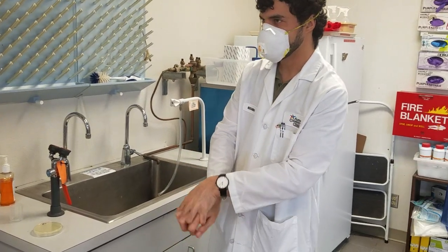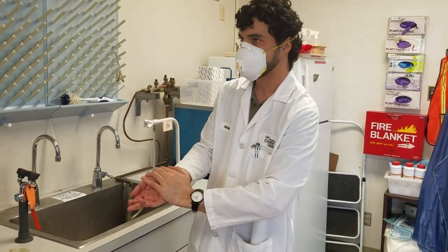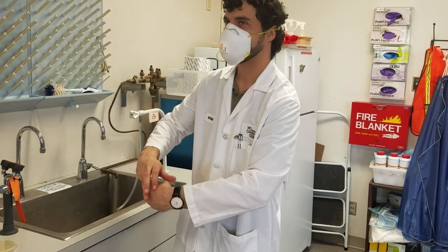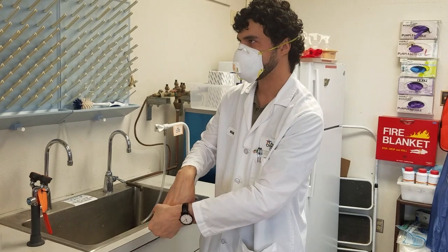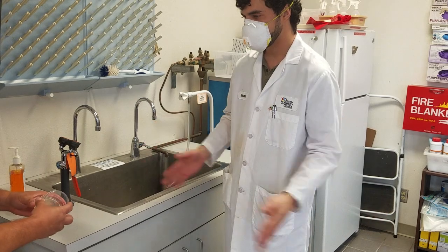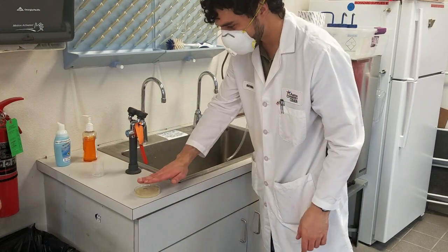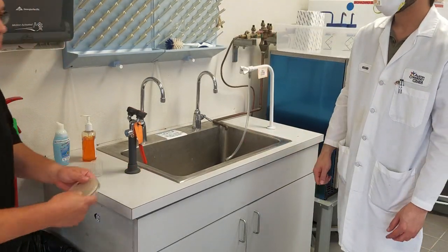One thing to note is that everybody in this video is a laboratory professional, so their technique is a lot better than we would normally see with students, although with the SARS-CoV-2 pandemic everyone has gotten more diligent about keeping their hands as clean as possible. Now his hands are dry and he's going to make an impression of his fingers and thumb. These will be incubated for 24 hours at a permissive temperature.